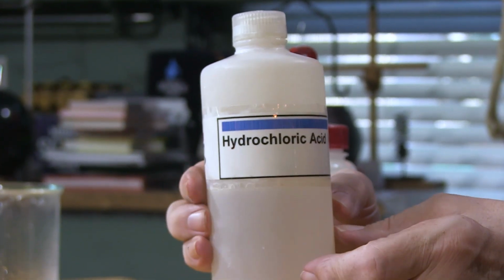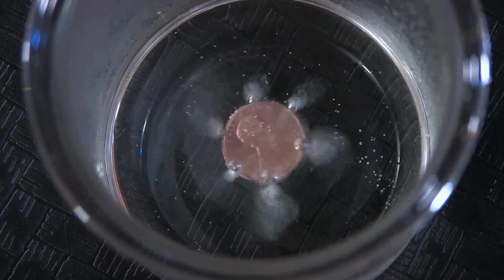Hydrochloric acid, that's mean stuff. I almost burned a hole in my hand. You see that steaming? Ooh, wee.